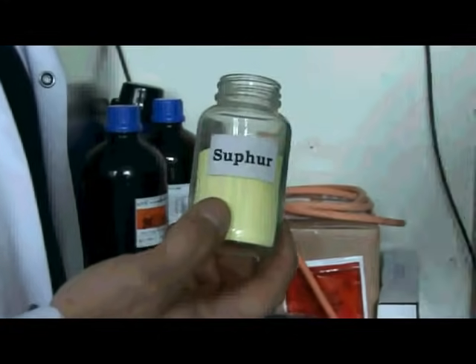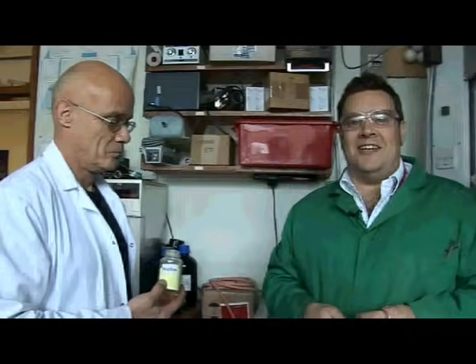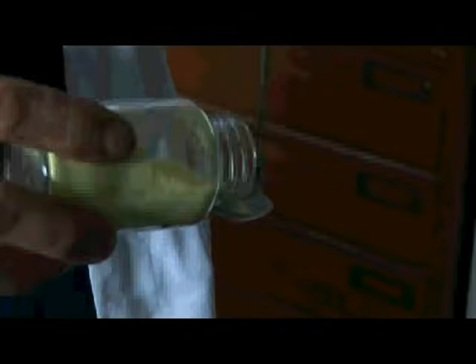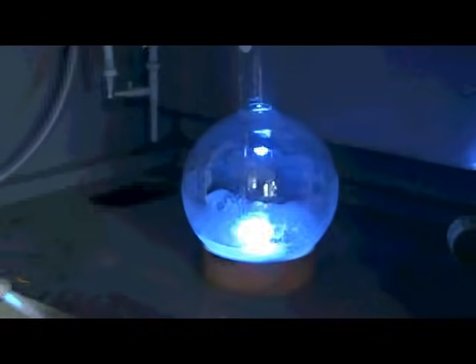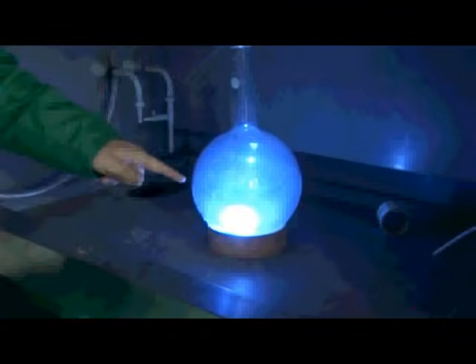This is a really quite crazy jar. It's a small amount of sulphur that we've decanted out, and unfortunately when we decanted it out we spelt the name wrong. Who's responsible for that? It's a very old friend of mine - I couldn't possibly give you his identity - and it wasn't Neil. So here we've got a small amount of sulphur that we're going to put on the tip of this spoon. You can see it's starting to melt and it's on fire, then we'll just drop it into the flask. You can see that sulphur is burning really intensely now with a really quite beautiful flame. It's generating a lot of SO2 - really smelly - which is why we're doing it inside this fume hood. You can see the really rich intense blue flame as that sulphur is burning in that excess oxygen atmosphere.